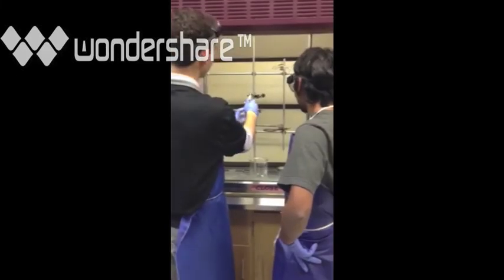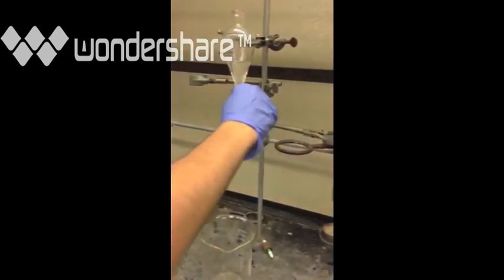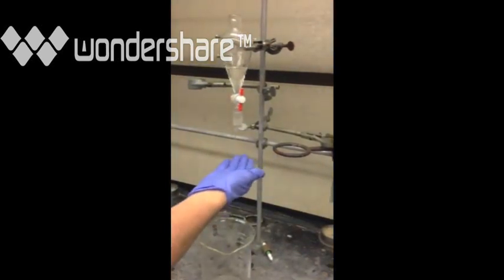As a last point, we want to make sure you don't do things like point it at someone when you're draining the pressure. That could be dangerous. Look at that. Adi is obviously hurt. Don't touch the liquid like that. That's stupid. And be sure to use your PPE.